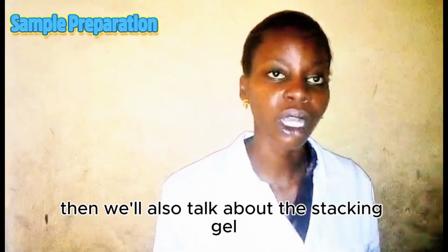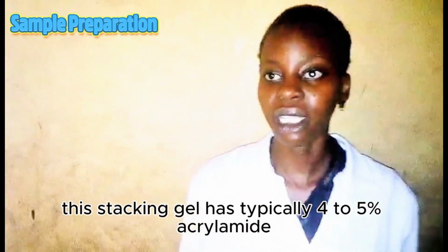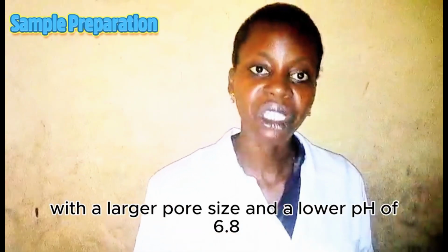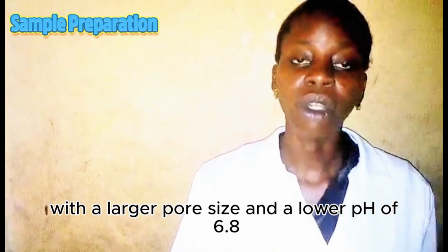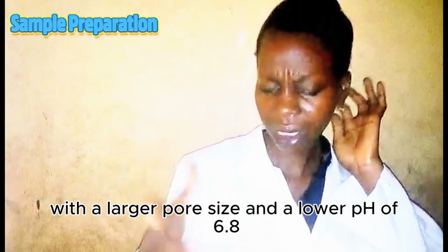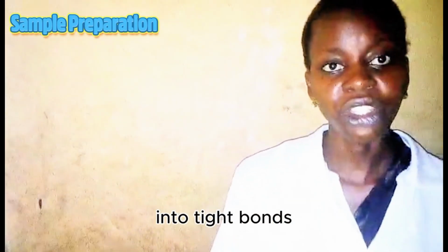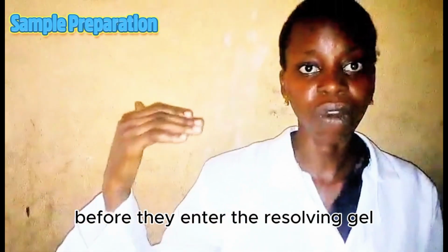Then we'll also talk about the stacking gel. This stacking gel typically has 4 to 5% acrylamide with a larger pore size and a lower pH of 6.8. It aligns and concentrates all the proteins into tight bands before they enter the resolving gel.